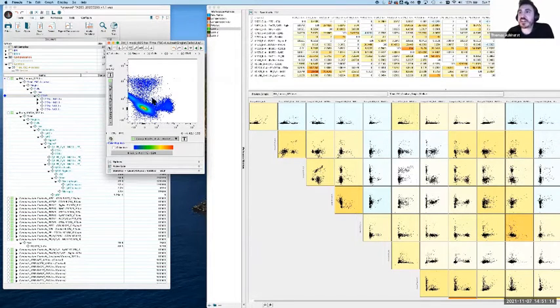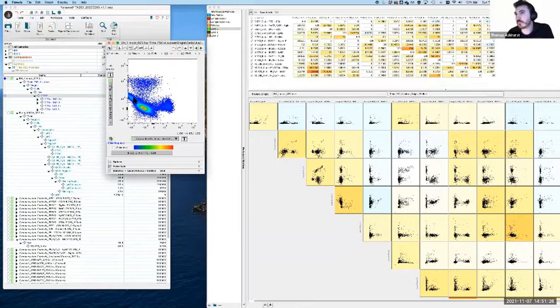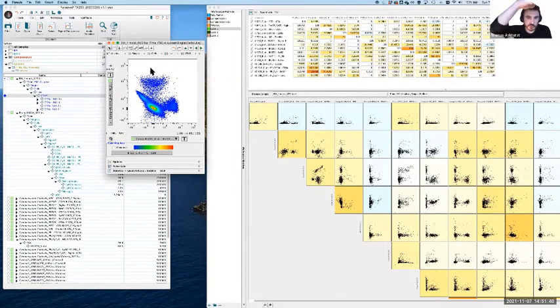So I'm close. Actually, I'm going to extend this out a little bit to make it easier to view. Cool. So I'm close, right? This looks like it's leaning to the left. So okay, I'm on the right path, but actually there's this whole positive group up here, and that's not leaning. So this isn't a mathematical curving of the data as it gets brighter. Something is still weird here. So as much as that would have been my classic go-to to blame PE-Cy5, because I blame PE-Cy5 for everything, that's not the case here, which is going to drive me mad.